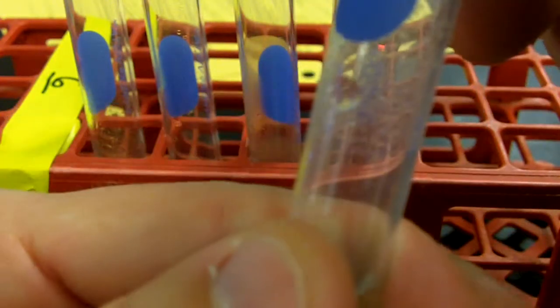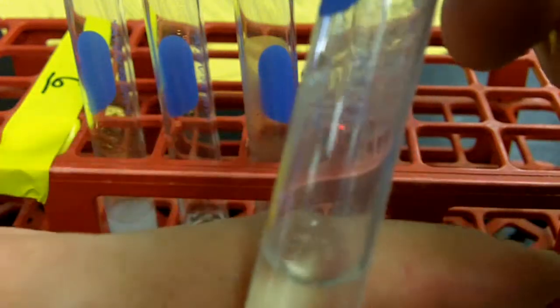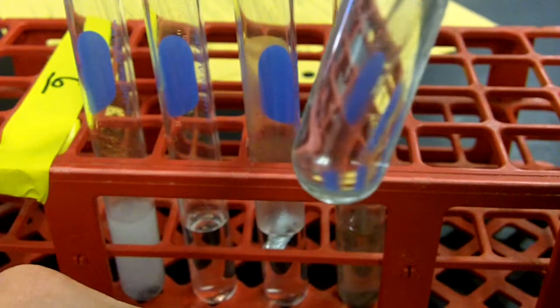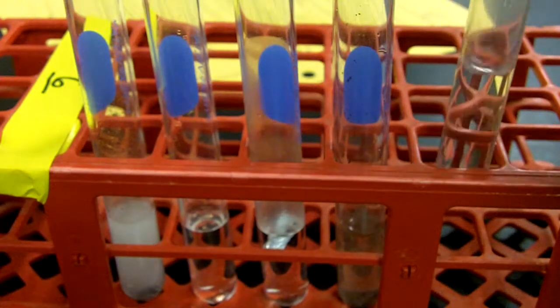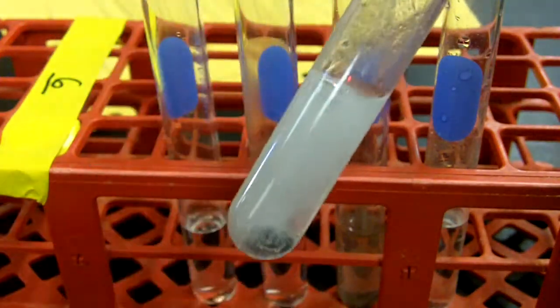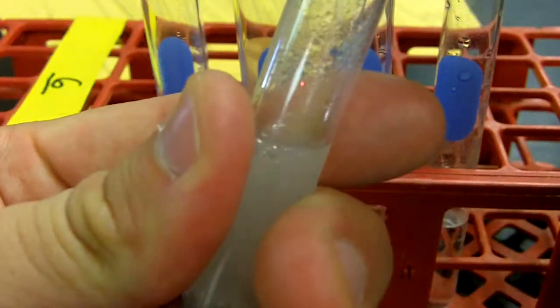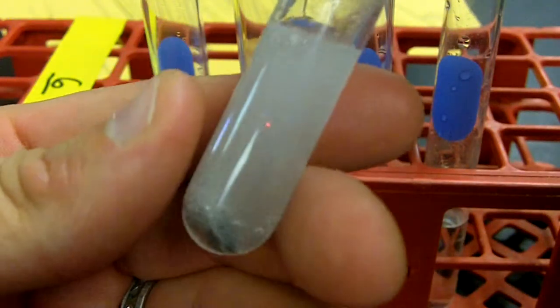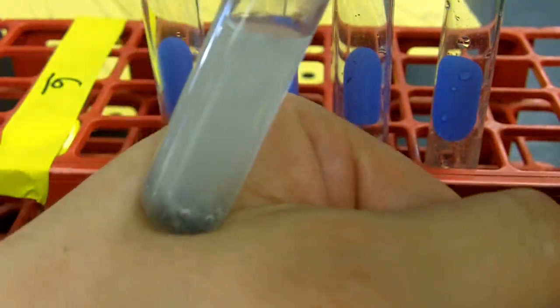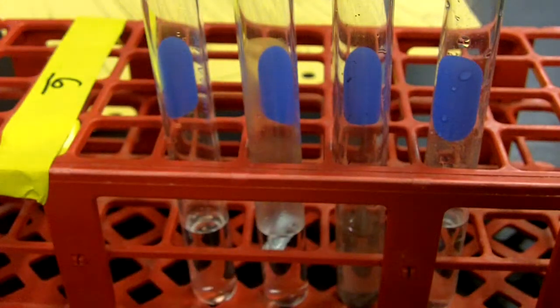Whoa, this one is considerably warmer than it started out. Started out at room temperature, but putting it against my hand, I definitely feel heat. So please, in addition to the bubbles for magnesium, record that the temperature increased. Heat was released, in other words. Let's check the same thing for the zinc reaction, still going strong. I detect a temperature increase. It's not as hot as that magnesium, but a definite temperature increase on the zinc. So heat with the zinc.